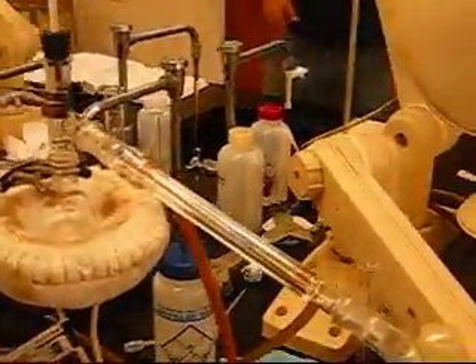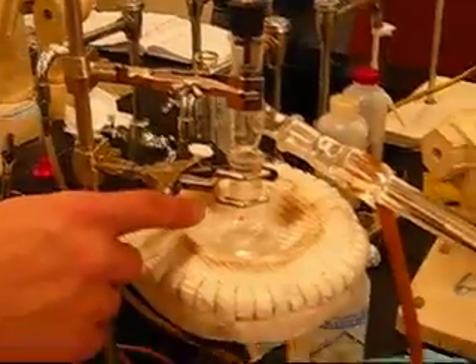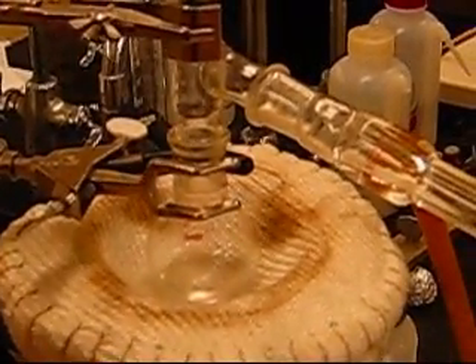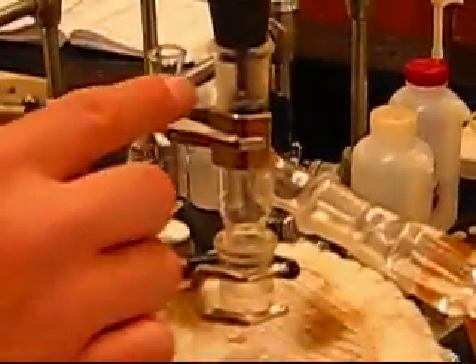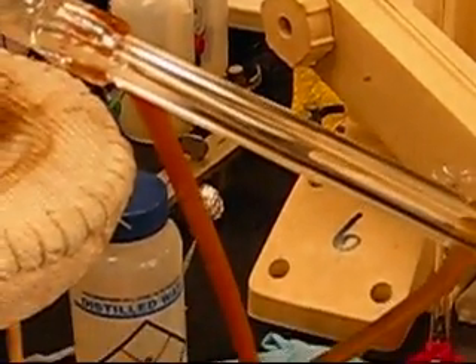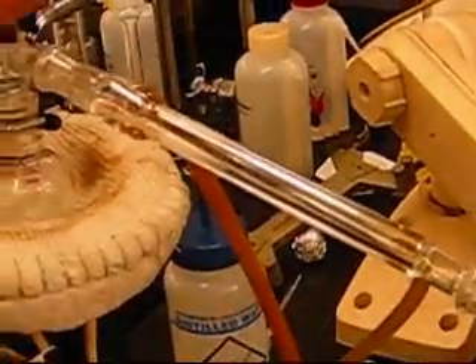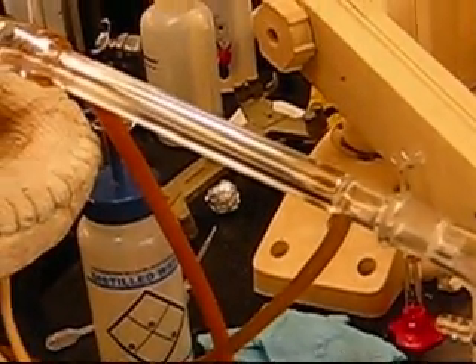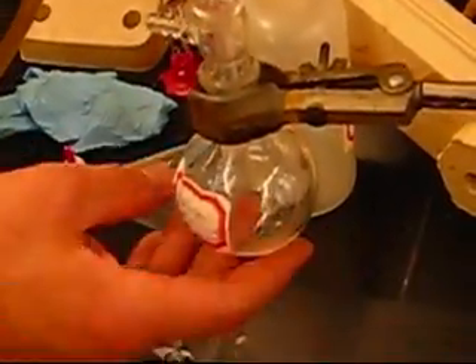Can you explain what exactly is occurring here and what's about to occur? So this is going to boil — what's happening is this is going to get really hot into where it begins the gas phase. It's going to evaporate and go up, and since it can't come out here, it's going to have to come through here. As it comes through here, it's going to see that the walls of this glass are really cold because of the water, and it's going to bring those molecules from the gas phase into the liquid phase because it slows down the motion so they can stick together again. Then what you have is your distillate — that's what we call it when it comes back down into the liquid phase. It's going to condense and flow right on through here to where we capture it.